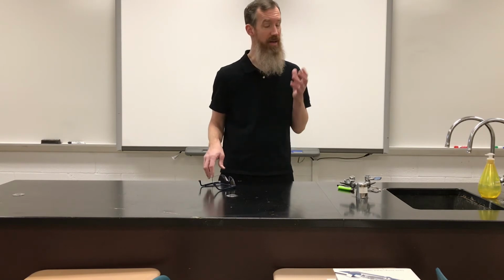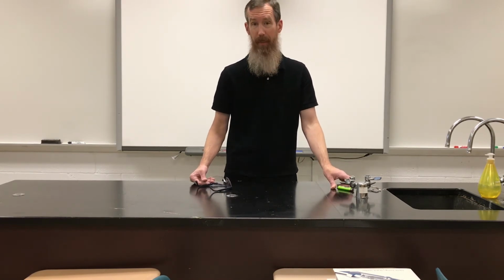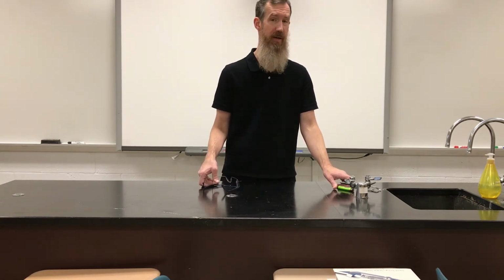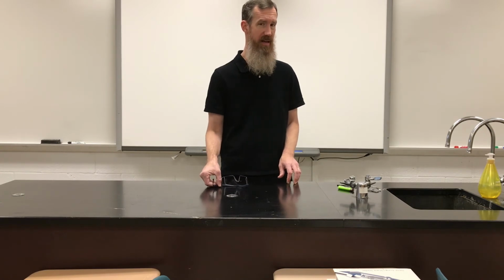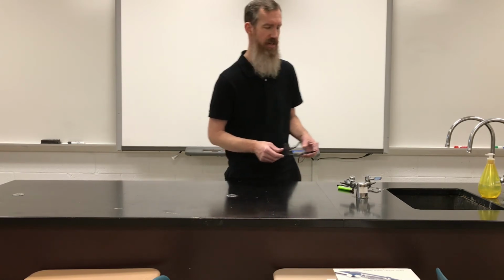Now, when they do react, if we give them a little spark, well, it'll burn. And this specific kind of burning is called combustion. There's a difference between burning and combustion. We'll get into the nitty-gritty of that later. But what's going to be hard to tell is what are the products. Well, let's see the reaction and see what change happens, okay?